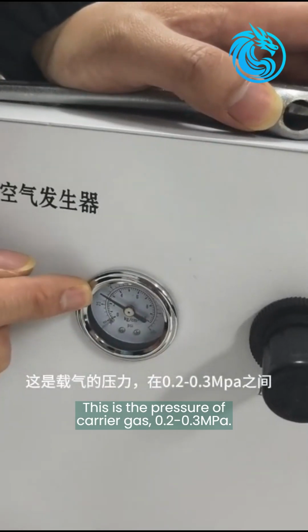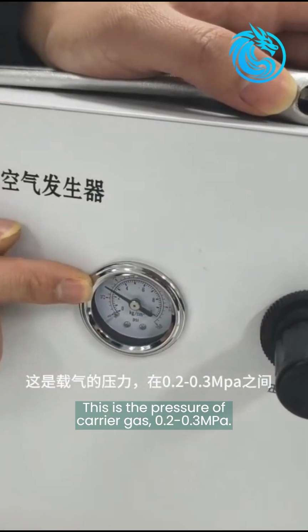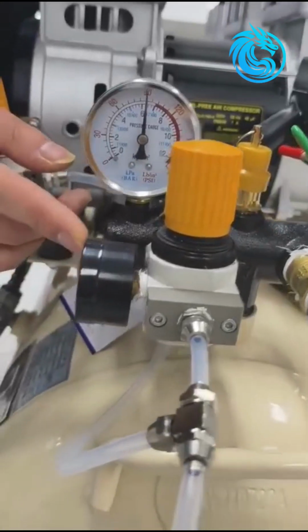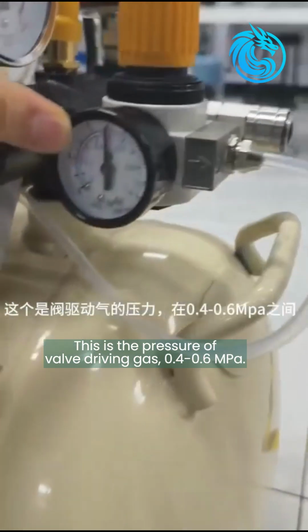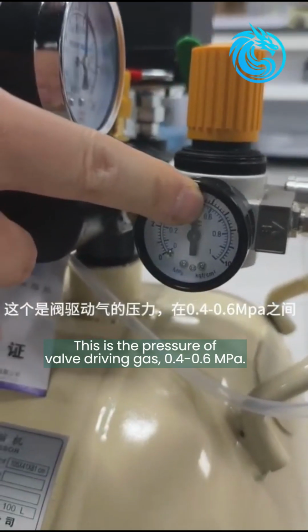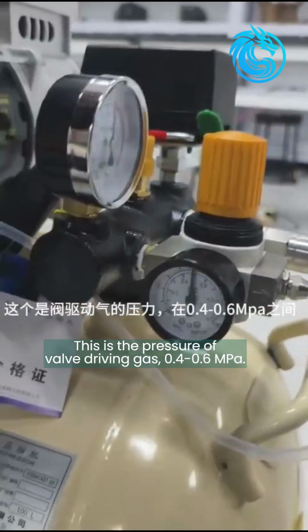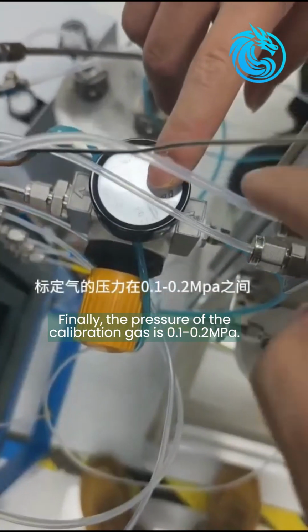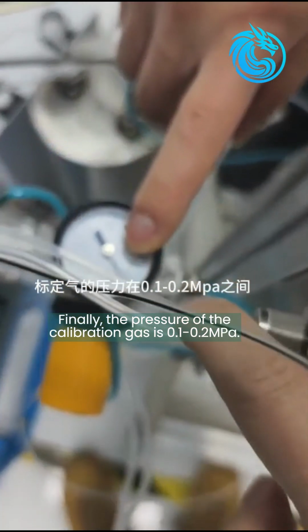This is the pressure of carrier gas, 0.2 to 0.3 megapascal. This is the pressure of valve driving gas, 0.4 to 0.6 megapascal. Finally, the pressure of the calibration gas is 0.1 to 0.2 megapascals.